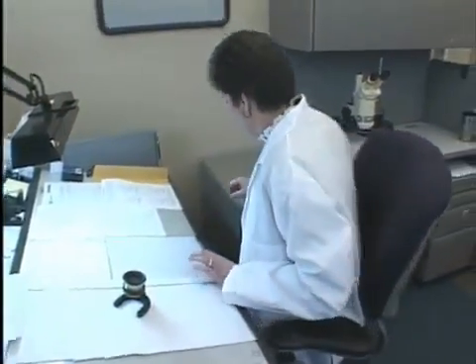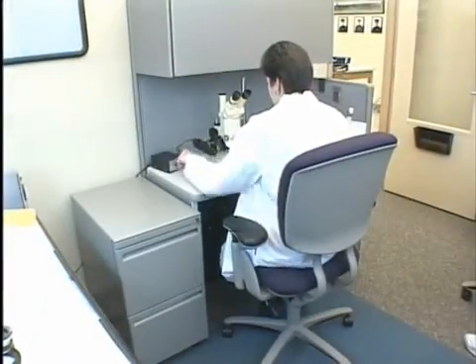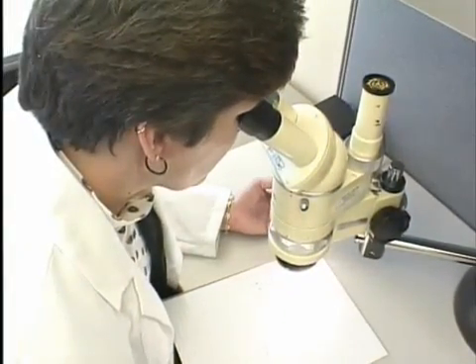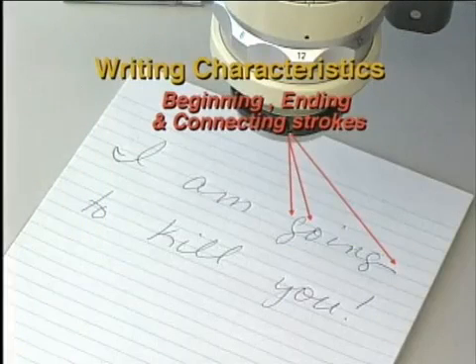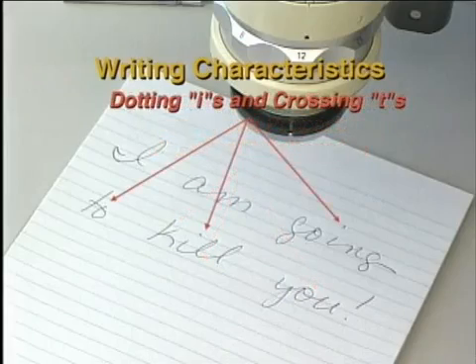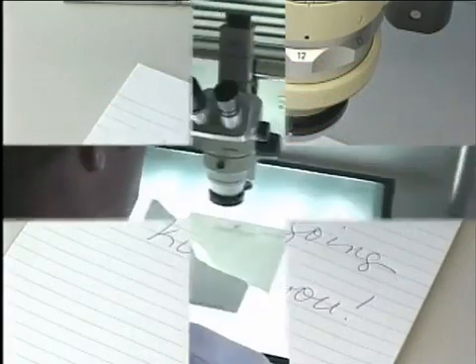Using tools that include the magnifying glass and the microscope, along with the examiner's experience and knowledge, the samples are compared to the question document. Characteristics the examiner may take into consideration are beginning, connecting, and ending strokes, pen lifts, pen pressure, line quality, letter formation, spacing and proportions, baseline relationship, dotting the I's and crossing the T's, and the general overall appearance of the writing.